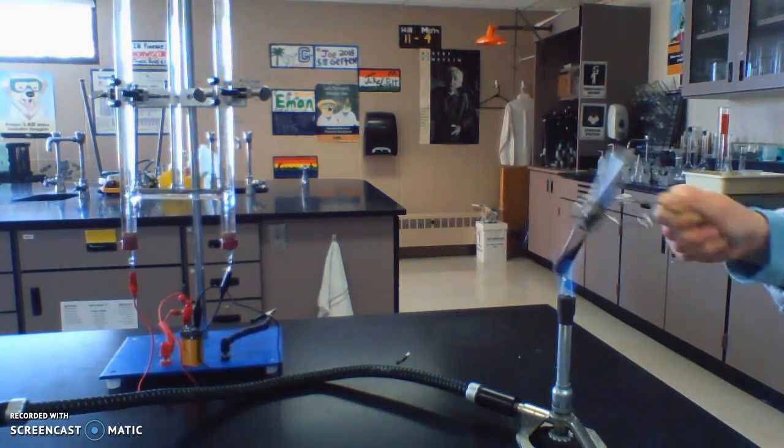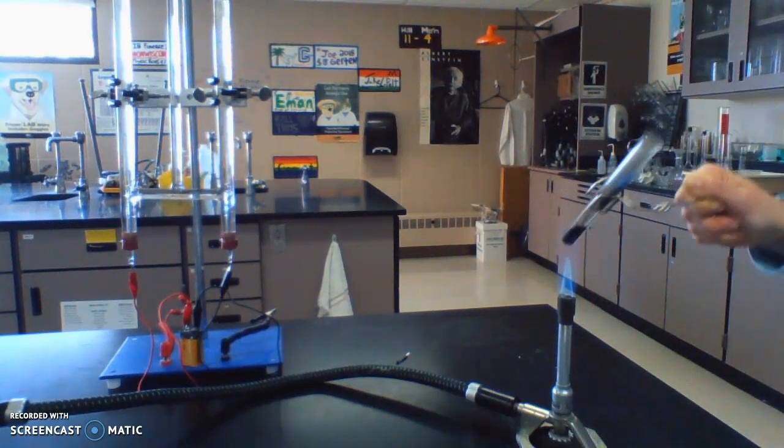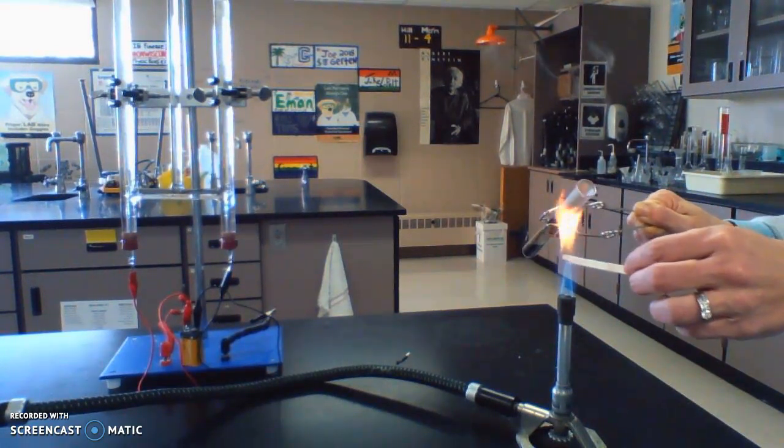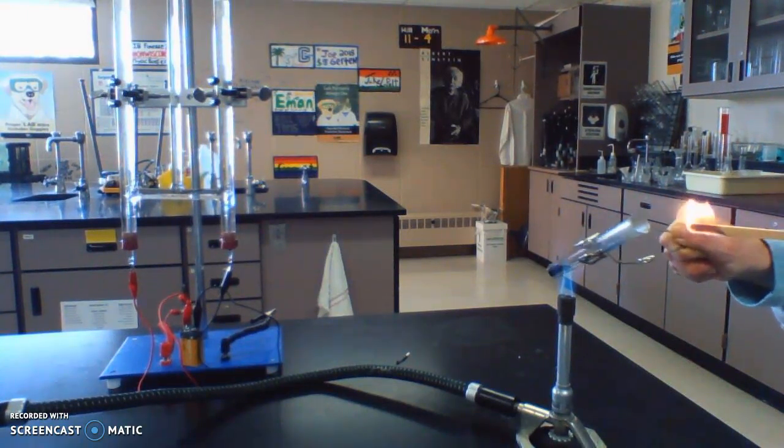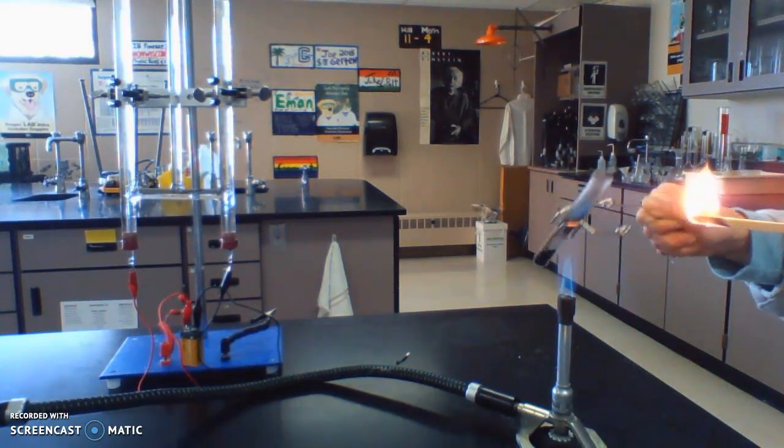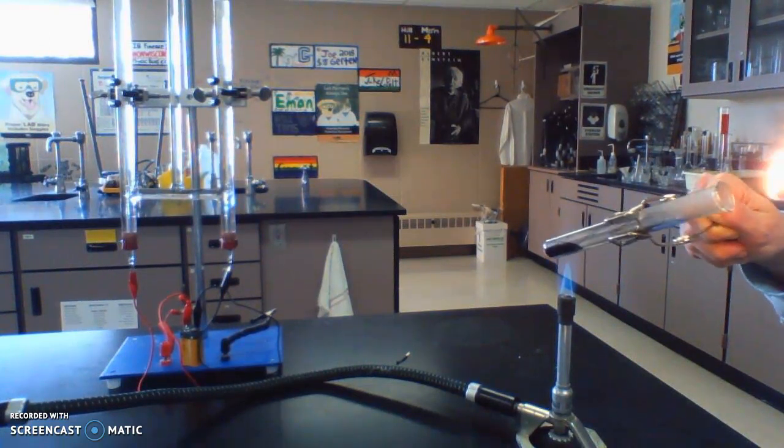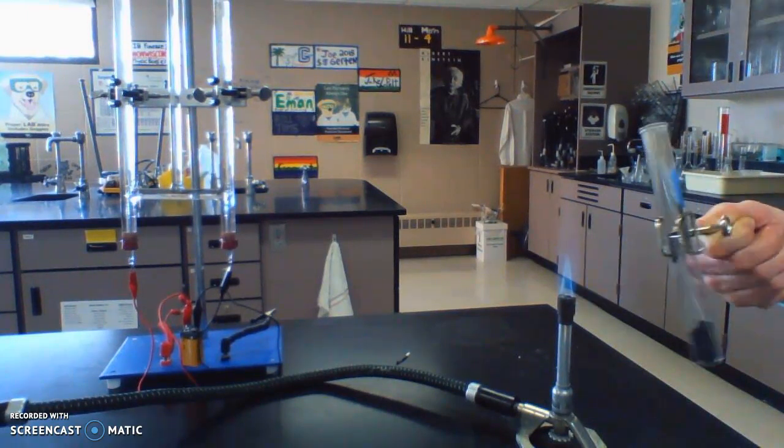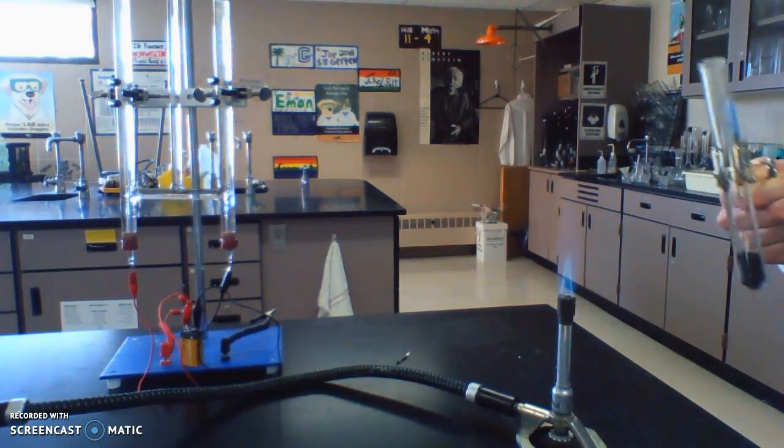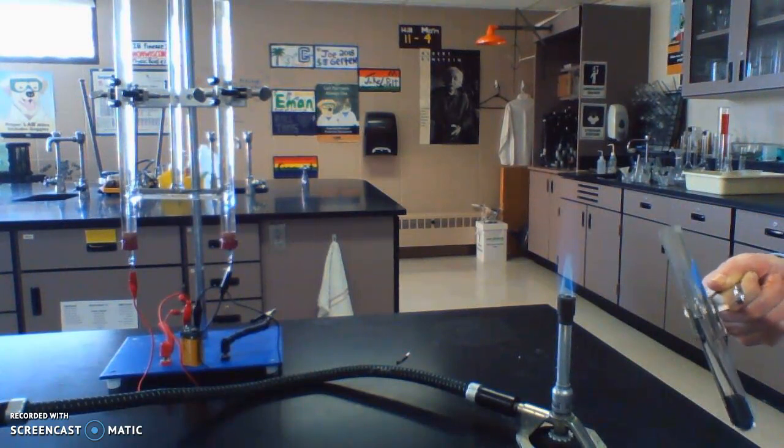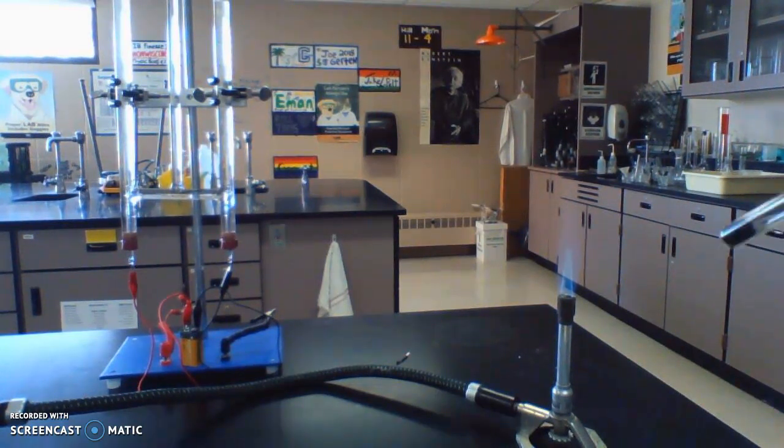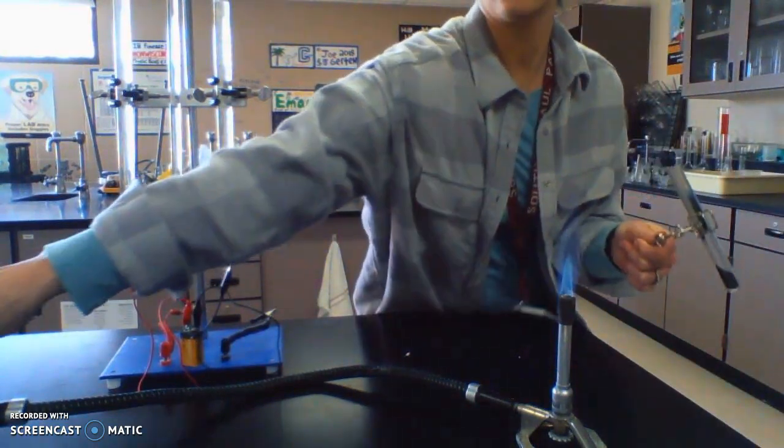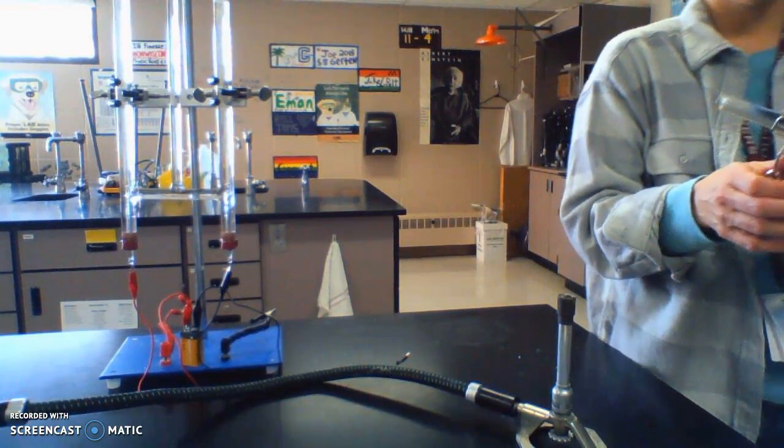I'm going to move it around as this happens. You're going to see a definite color change. That green you saw is now this black. I'm going to take this wood splint and light it on fire. As this burns it creates a gas.